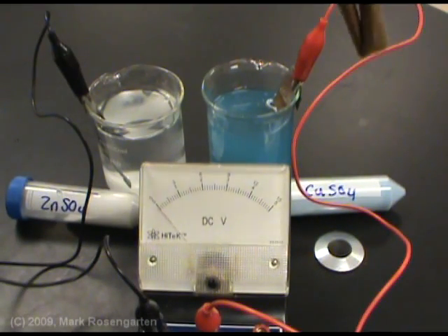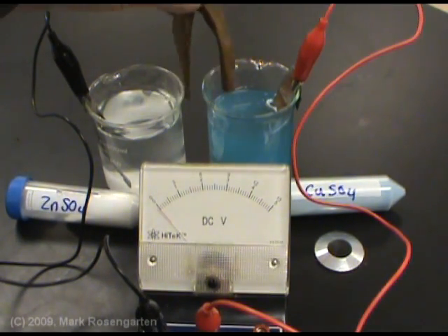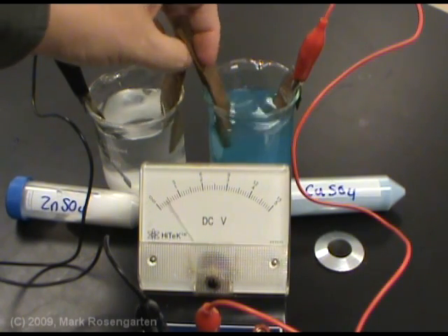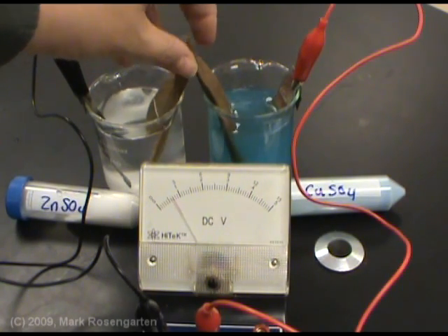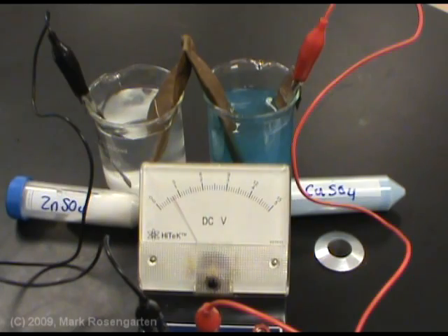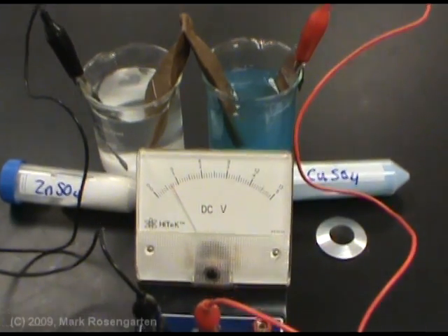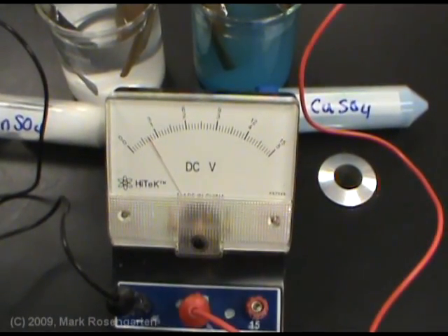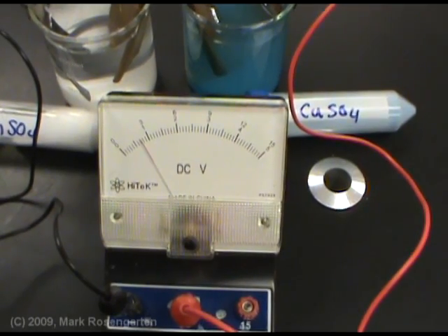Watch the voltmeter as the salt bridge is placed between the two solutions. Ah-ha! Look what we have here, ladies and gentlemen. We have ourselves some voltage. A little less than one volt.